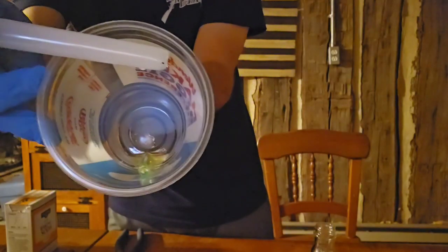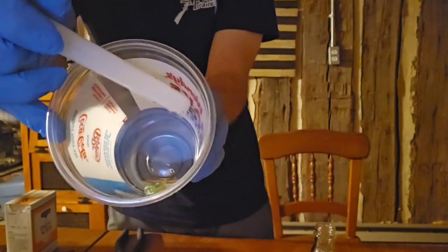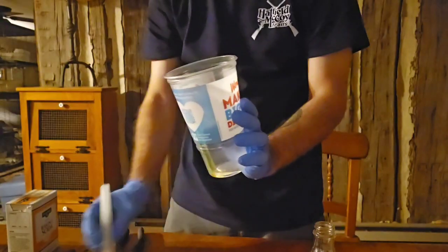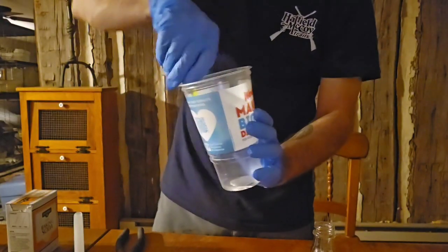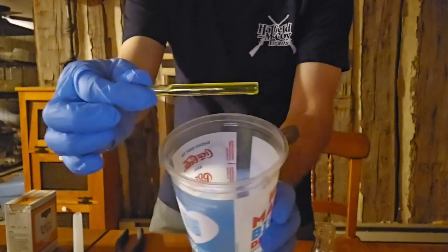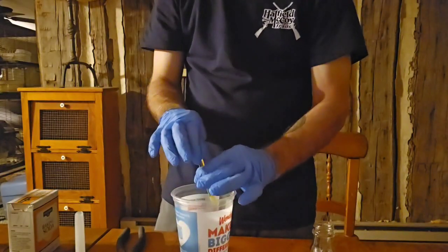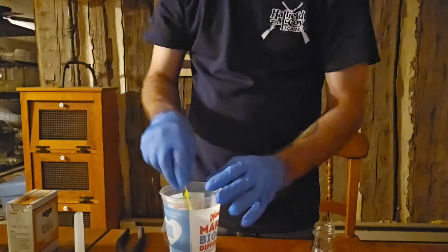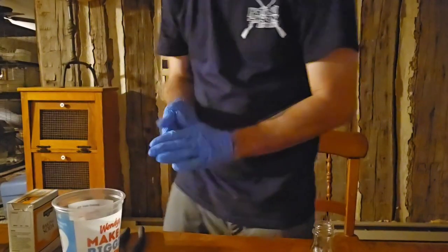I don't know, it's hard to get. There you go. See how it's glowing? It's real bright there. Okay, that's what we wanted. Okay, that's the glass. Now be careful because we're gonna have to break this glass, which is why we got gloves on and stuff. So see that? There's words. That's what's in the center of those glow sticks. Before we break that, we're gonna set that to the side and let that sit there for a second.